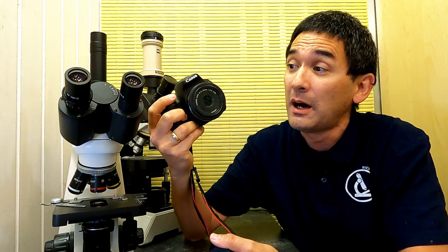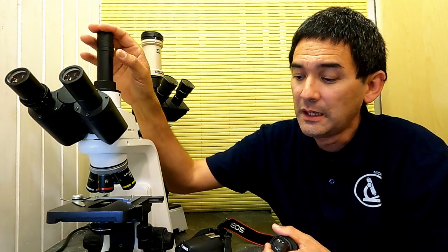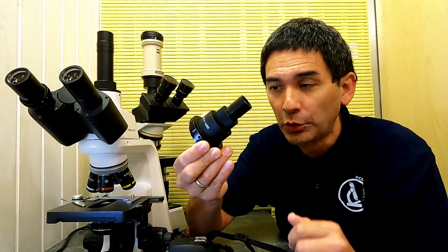So I'm going to explain it first. The idea is the following, that I would like to connect a DSLR camera, or these days even mirrorless cameras. How do you connect them to a microscope? I just want to use this microscope over here as an example. It's a pretty nice and decent microscope, and it has a photo tube up here, so I can connect cameras over here. And how do you now connect a camera like this to the top of the microscope? You need an adapter, a so-called DSLR camera adapter, which basically I got here.